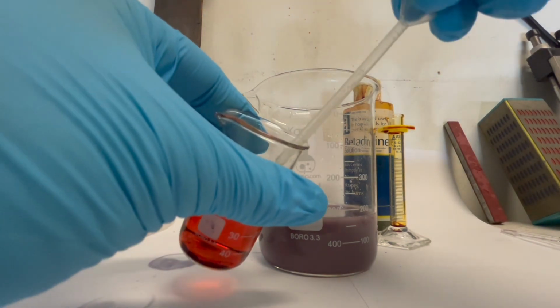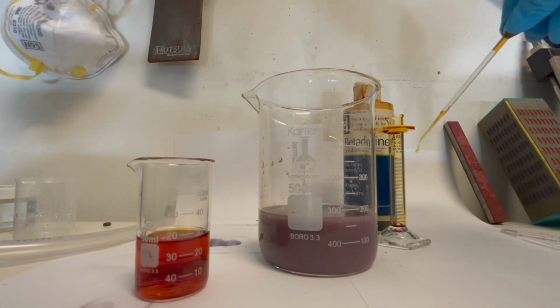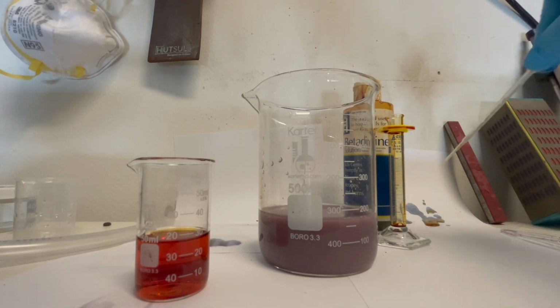To show that this triiodide ion can also complex with cellulose fibers, I squirt some using a dropper on my backdrop, which is just made of printer paper. It quickly complexes the cellulose fibers, making this black color.